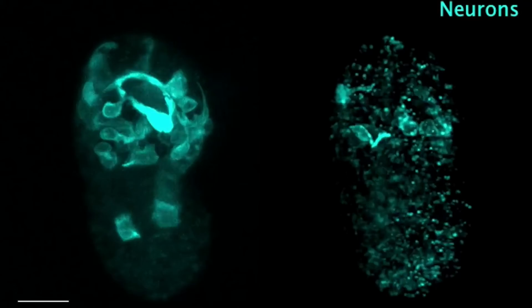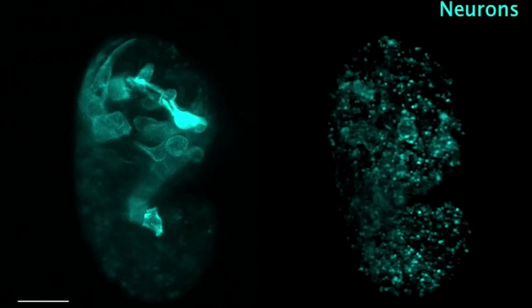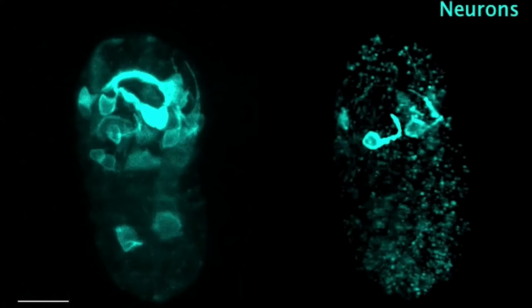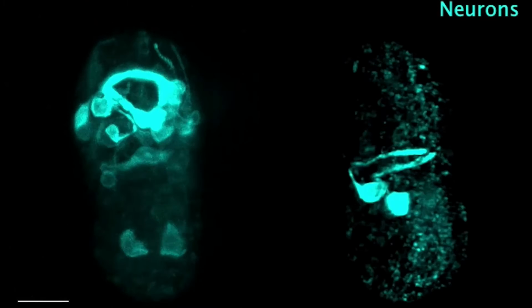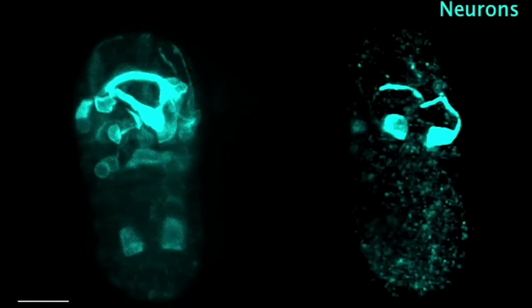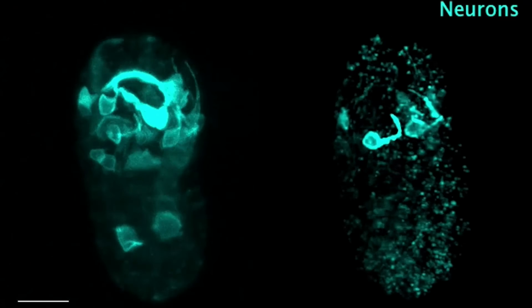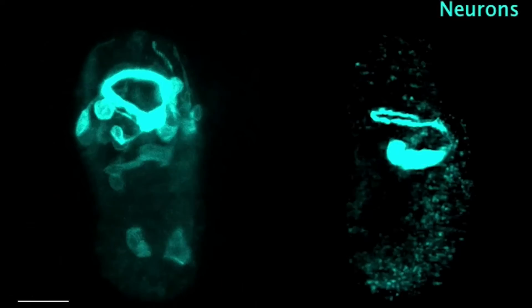Imaging is one of the most visual ways of measuring biology, right? So you actually get to see what's happening, and that's one of the strengths of this technique as well, that you get this dynamic description. So when we look at those videos, we would see fluorescently labeled neurons in living C. elegans embryos as they are developing. And so you can look at individual neurons, the decisions they are making as they're born, as they grow out, as they're placed in the brain that's also developing at the same time.